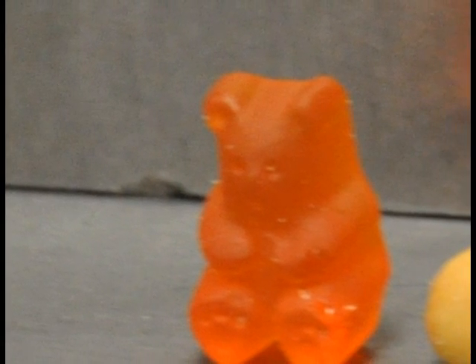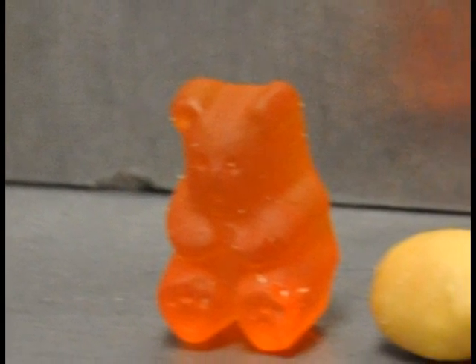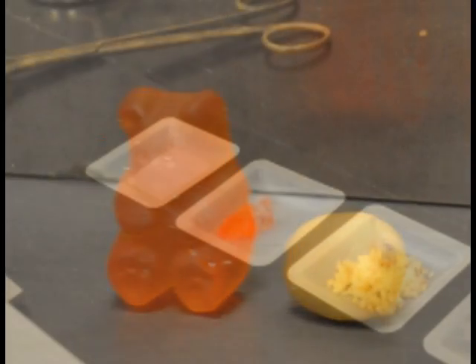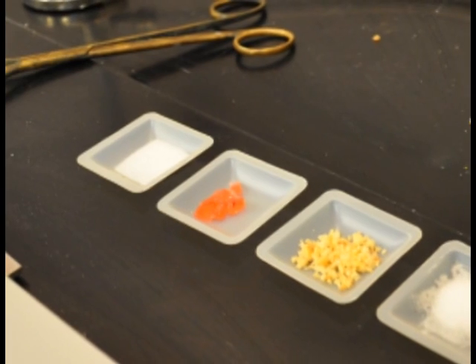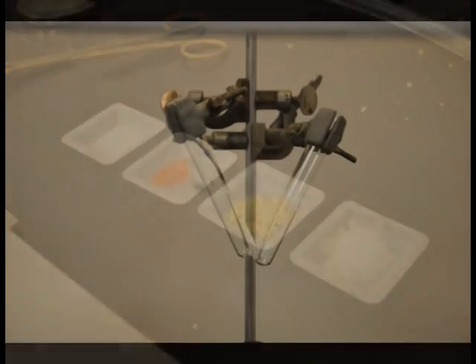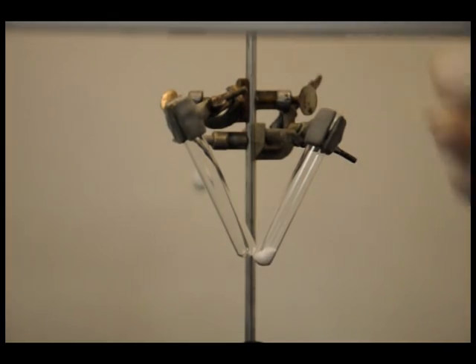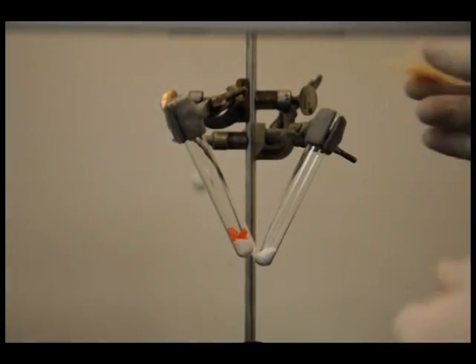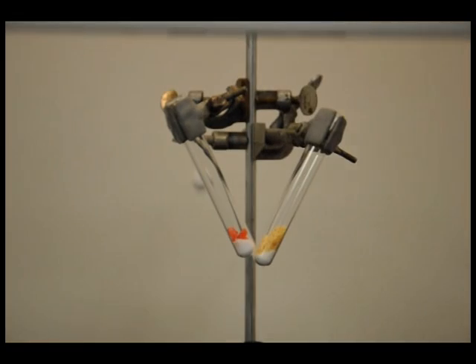It may also be interesting to note that this same reaction can be used to qualitatively compare the caloric content of various foods. For example, if we take half a gram gummy bear and half a gram peanut and place both in the molten potassium chlorate, we see a difference in the duration of burning as an indication of the caloric content of each food item per gram.